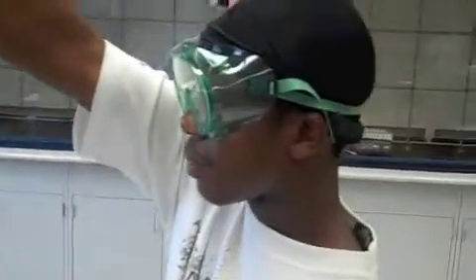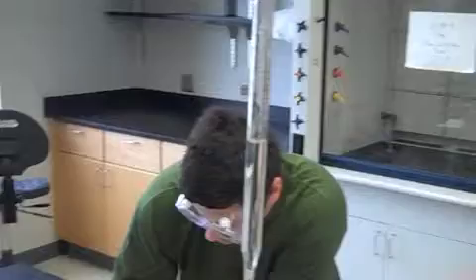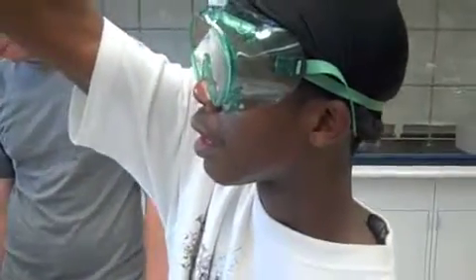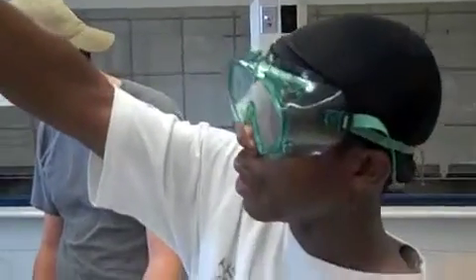Alright, now I'll try to take this and see exactly what I have. Okay, 2.8. Yeah, make sure I'm doing this right. 2.9 milliliters.